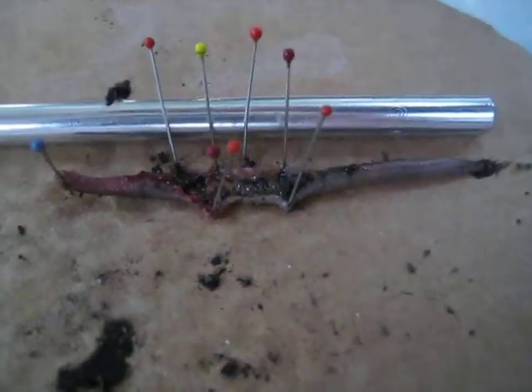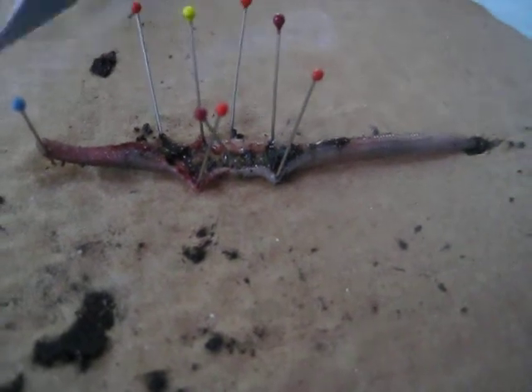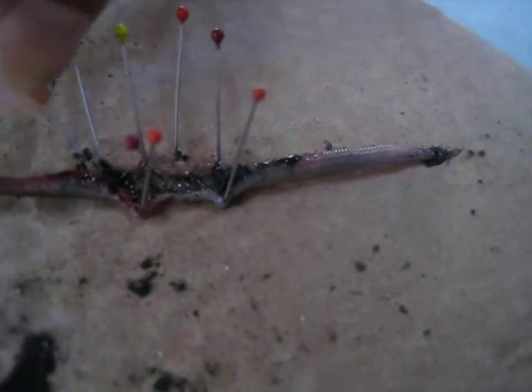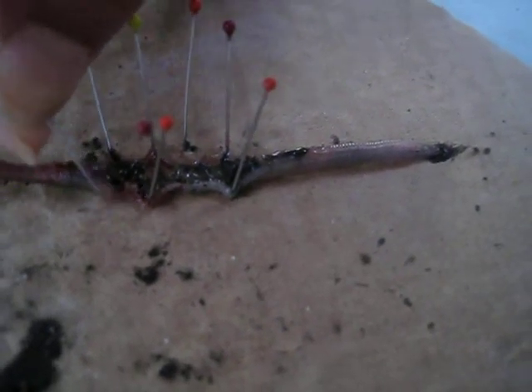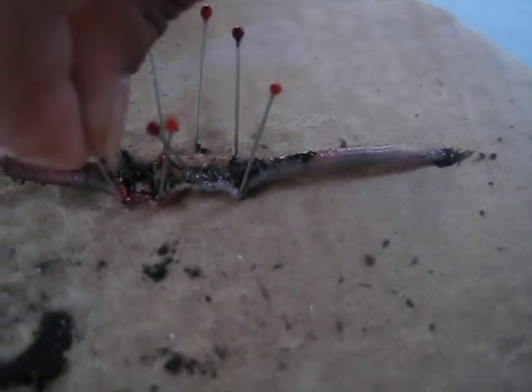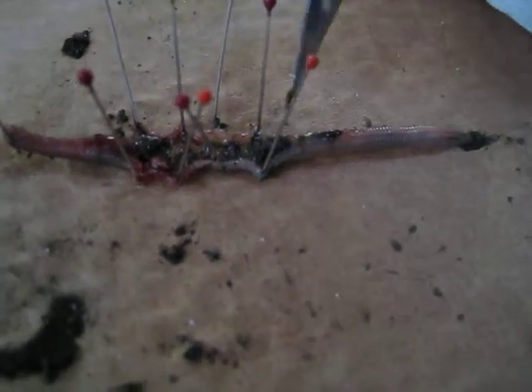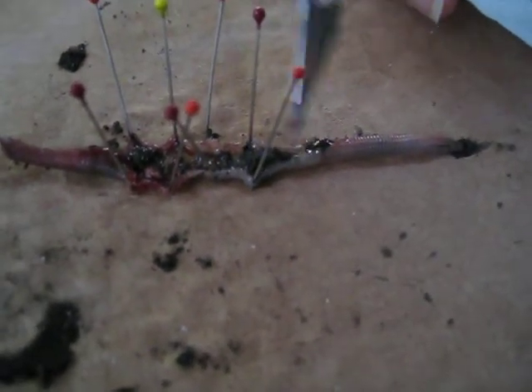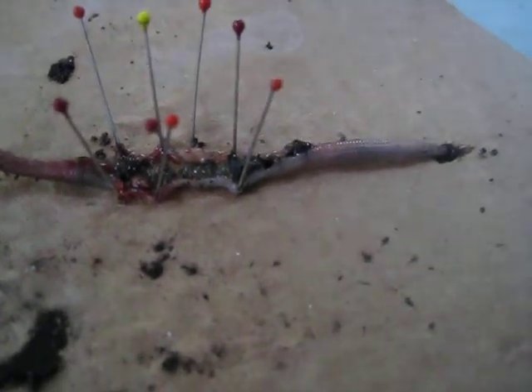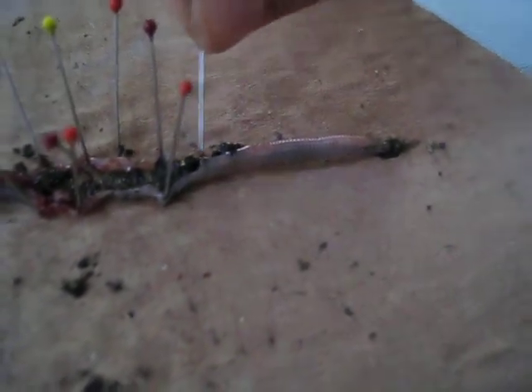Okay, this is a major fail. It touched that gross stuff — the poo, you mean? Actually, that's soil. What should go inside the intestines? Because it hasn't gone all the way through. We're not very gentle with it anymore — kind of gave up on that part. Should we keep on opening this even though it's exploded? I think it's the same all the way through. We're just missing the intestines, but those aren't very much to look at.